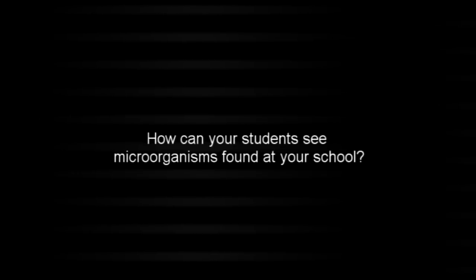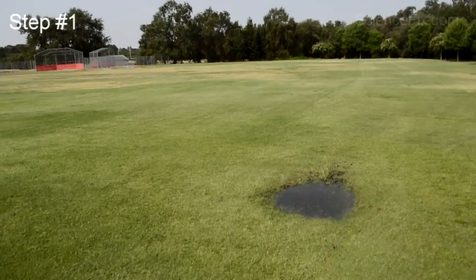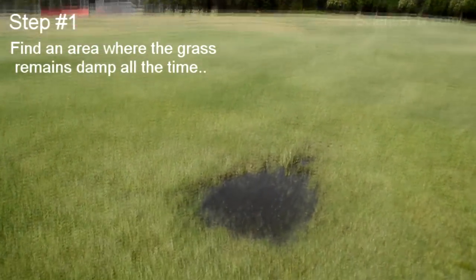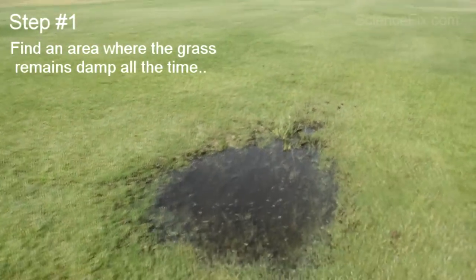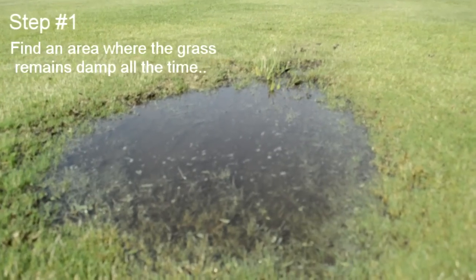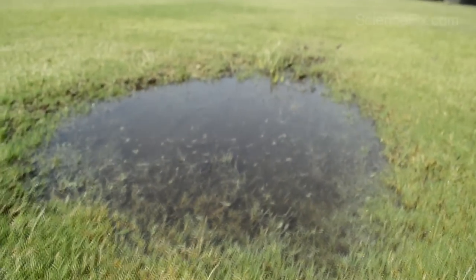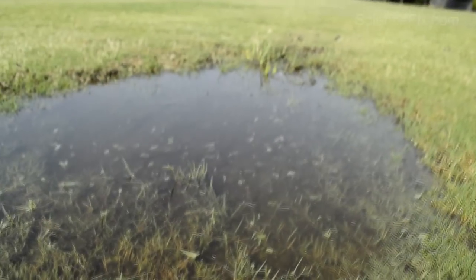How can you get your students to see really cool microorganisms found around your school? There are going to be a lot of grassy areas around your school, so find an area where the water doesn't drain too well — kind of some standing water. Put some of that water in a beaker and also pull some of that grass and maybe a little bit of that dirt and put it into the beaker.